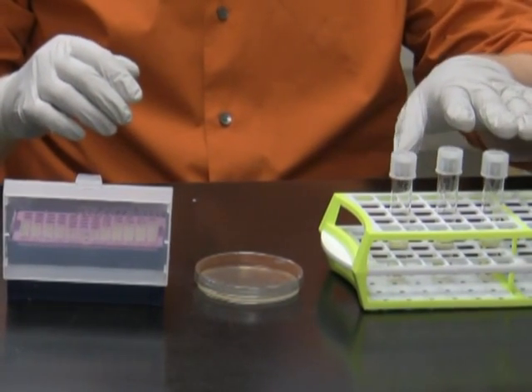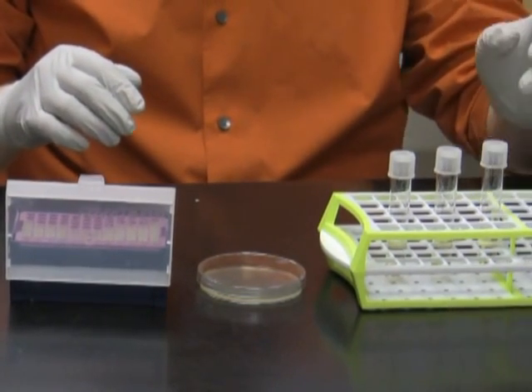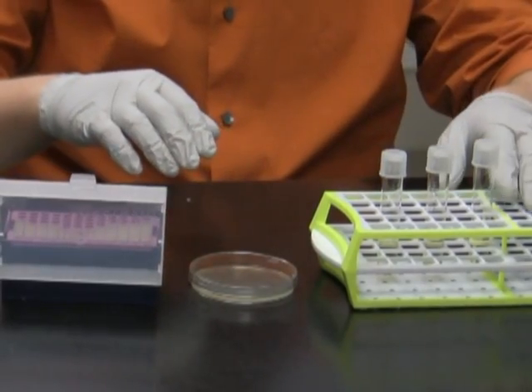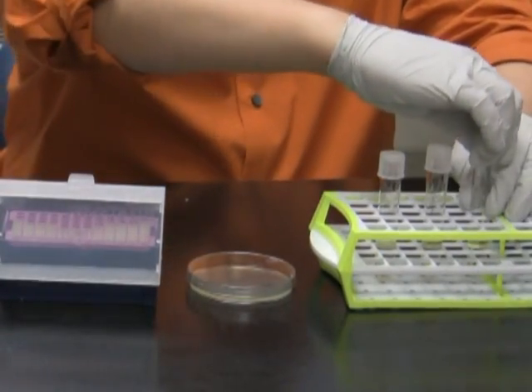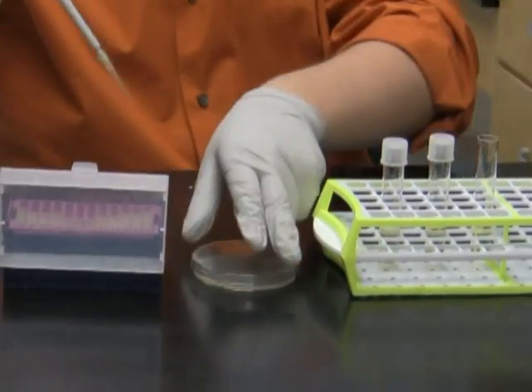Here I prepared 3 cell culture tubes with 4 ml of liquid LB medium with ampicillin in each of them. Right now I'm going to inoculate the colonies from the plates into the tubes. I open tube 1, pick a colony with the pipette tip, and inoculate it into the tube.